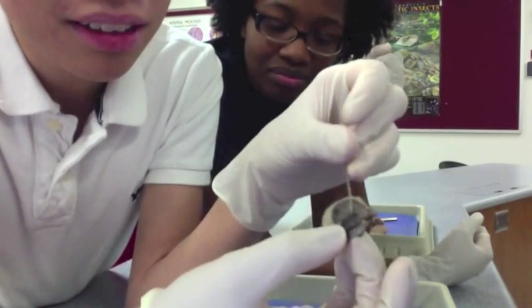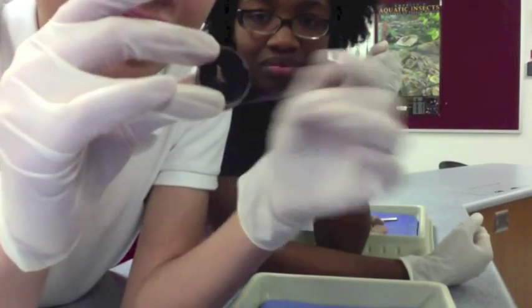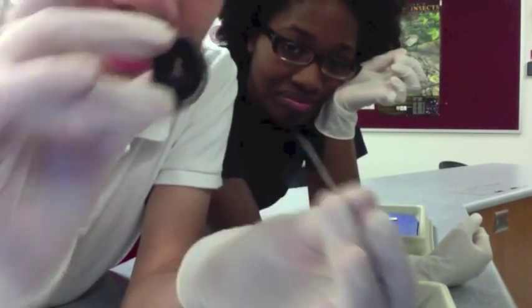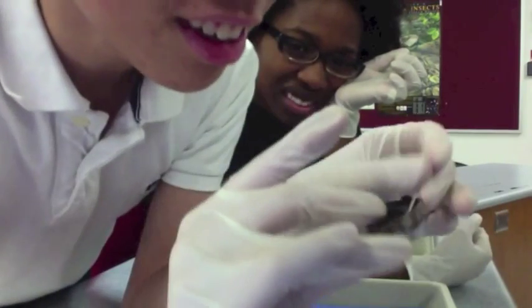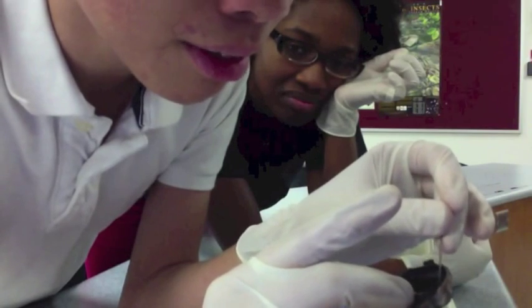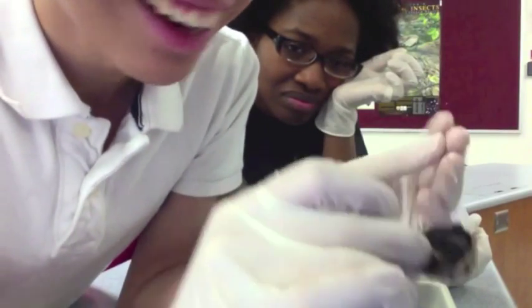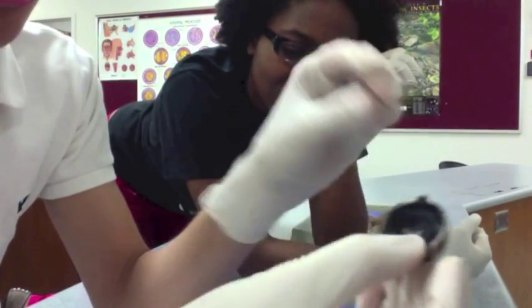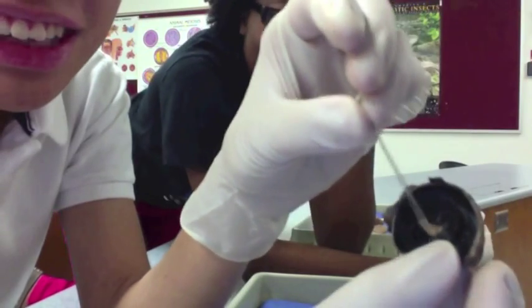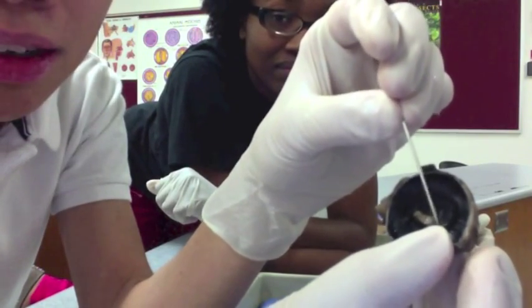In the front part, the ciliary body is the one that's a little bit more outer. The innermost layer is a little smoother, and that is your iris. The one that has more lines in it because it has a little bit more fibrous — that is your ciliary body. So the one that's close towards the middle, that's your iris — a little bit thinner and smoother. But on the outer is your ciliary bodies, which has more lines in it.